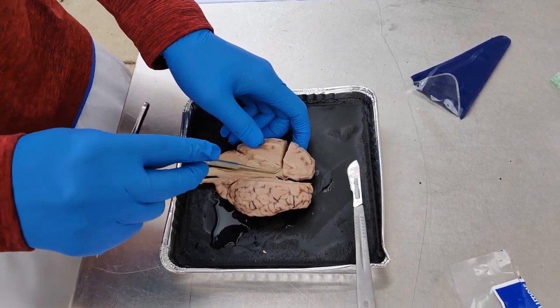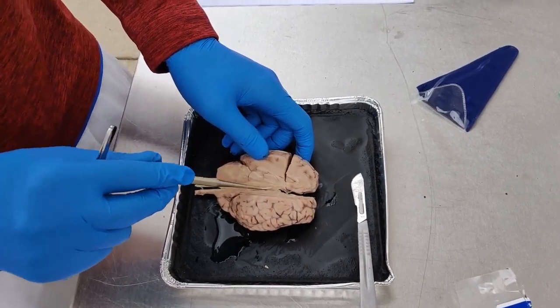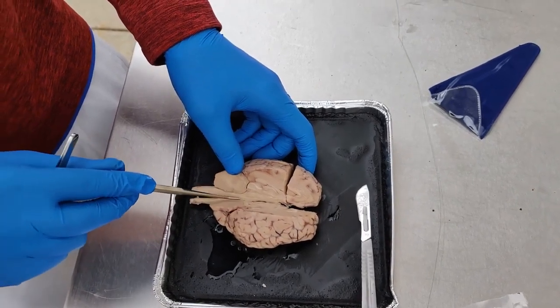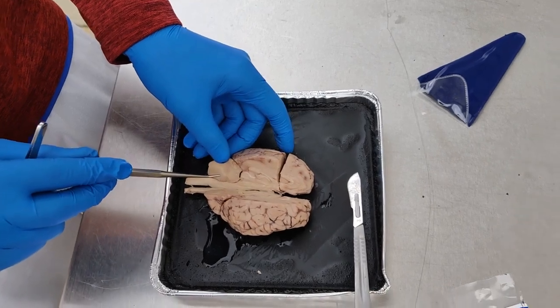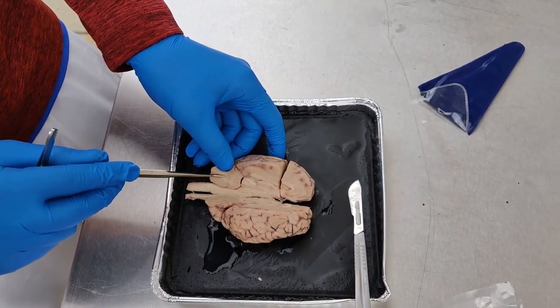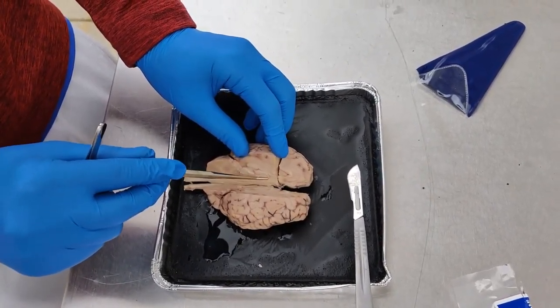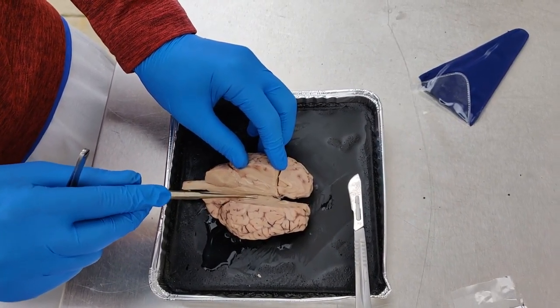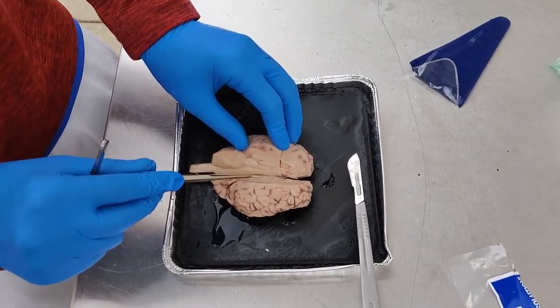And pons is basically just like all around here. It connects all these cranial nerves together. And then the medulla is right here. Well, it'd be on the other side of that. The branch tree-like pattern, the arbor vitae, is right here. You can see that's in the cerebellum. The midbrain is between the thalamus and the pons. So it'd be somewhere right over here. And that is responsible for nerve tracts and visual and auditory stimuli.